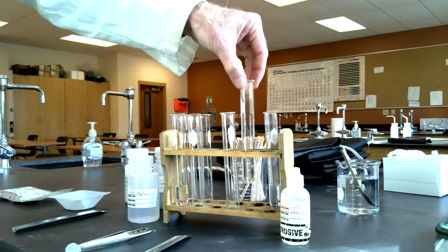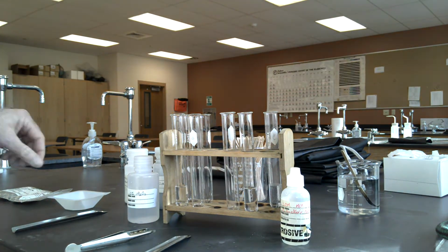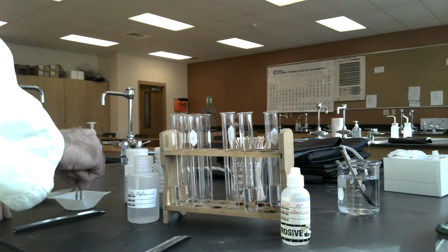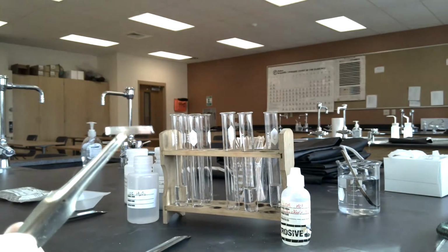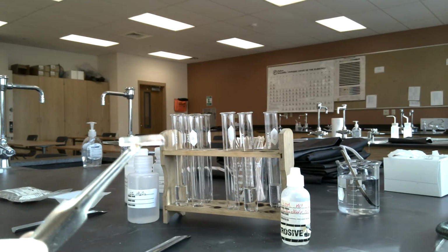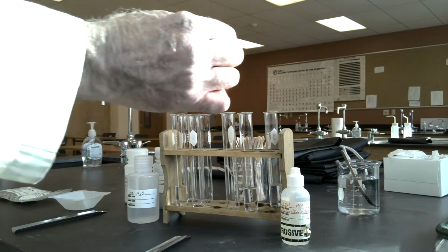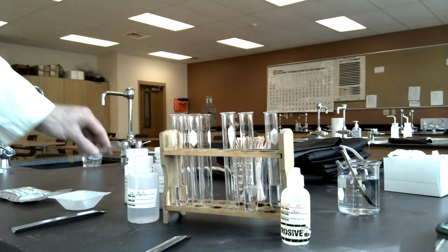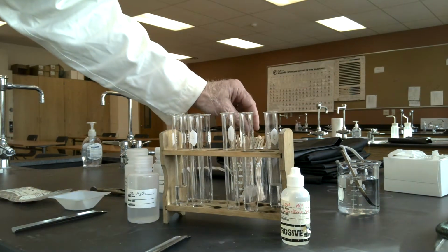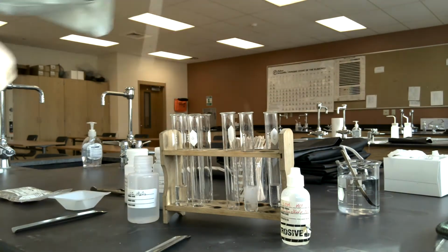All right, so with the second test tube, now that I have the hydrochloric acid, I'm going to take a piece of magnesium ribbon. So magnesium metal is a shiny metal, and it's from group 2A. It's an active metal. So I bent it slightly so that way it can fit into the test tube and drop down. And if you notice, we're starting to see some bubbling there. And so therefore, there's a gas being produced.